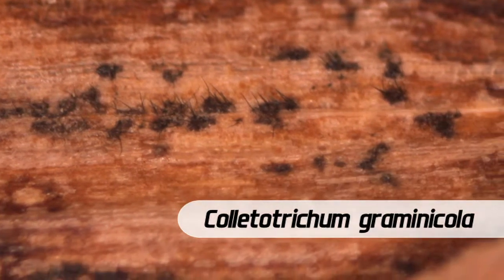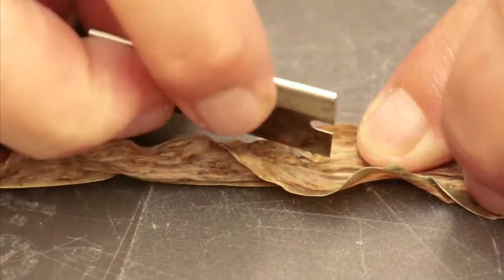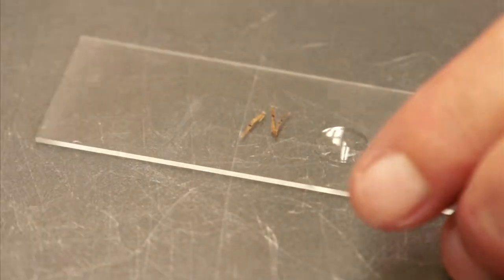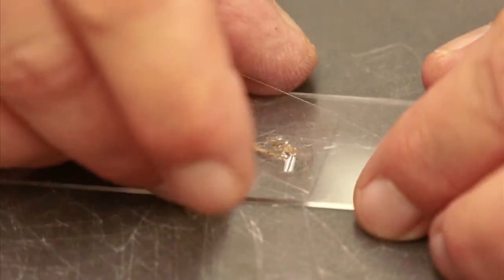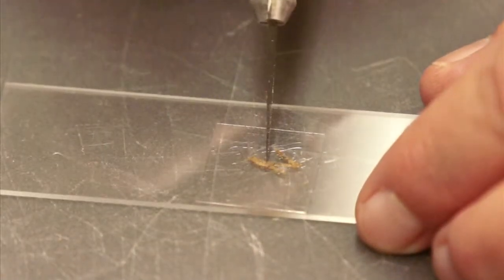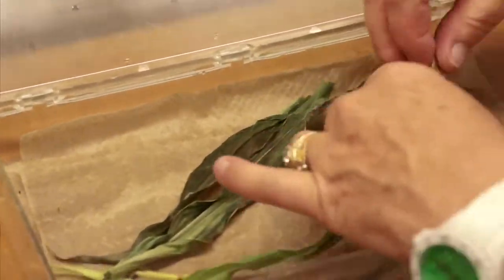The next step I'll want to do is actually make a slide, and what we'll be doing is going into the fruiting structure, cutting a piece of that, and seeing if we can find the spores of the fungus. Now, what if this isn't actually sporulating when I receive the sample? We might need to actually incubate it in a moist chamber to get spores produced.